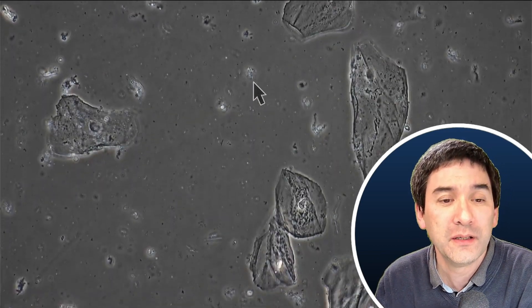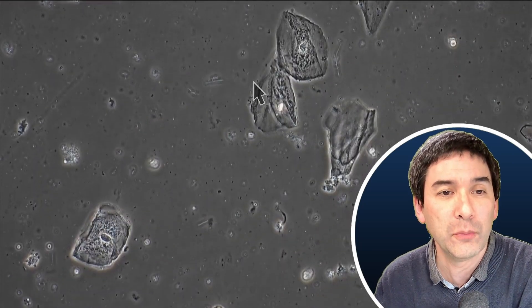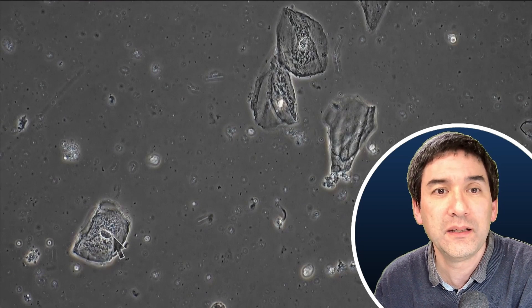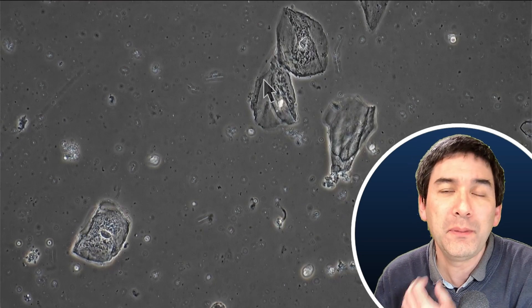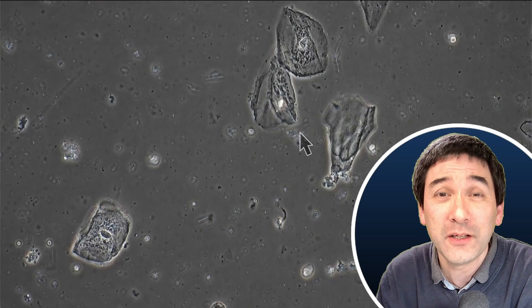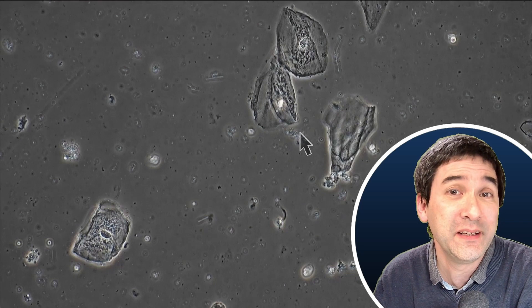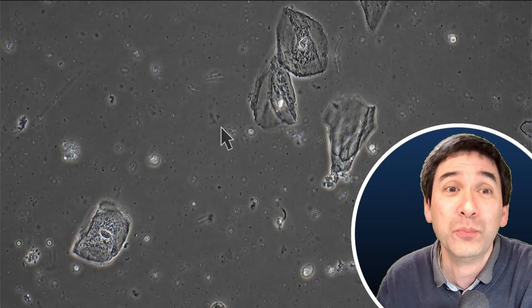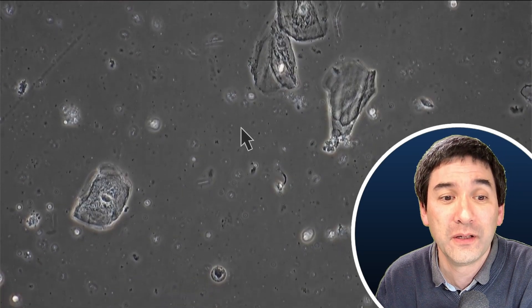Here again, we are looping the video back to the beginning. I'm going to pause here again for another look. Here is an epithelial cell — notice the nucleus in the center, and here as well. Those epithelial cells from the inside of the mouth are very flat; they like to be compressed between the cover glass and the microscope slide. And the bacteria, which are significantly smaller and thinner, are able to stream and move between the cells of my mouth.